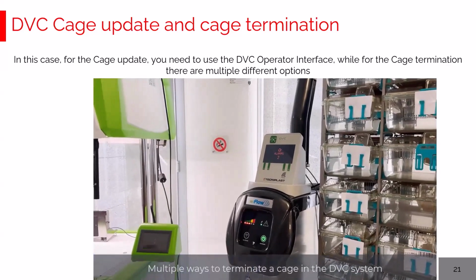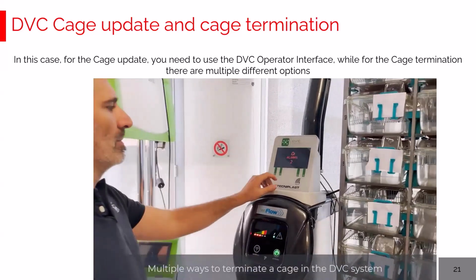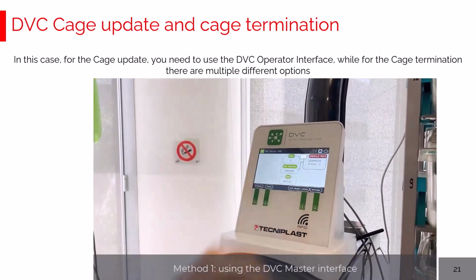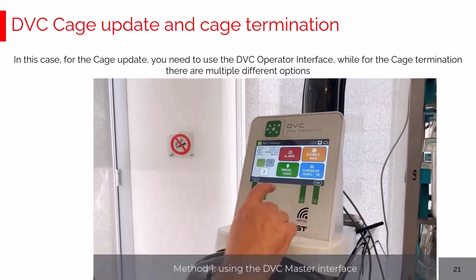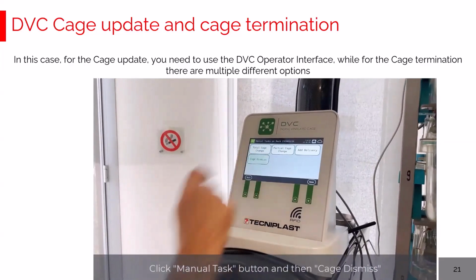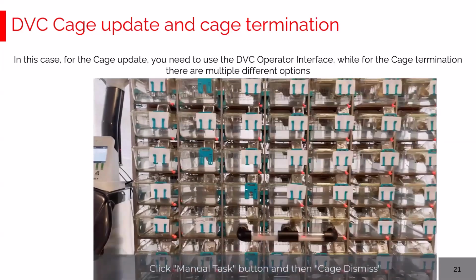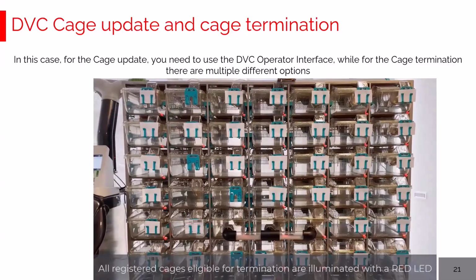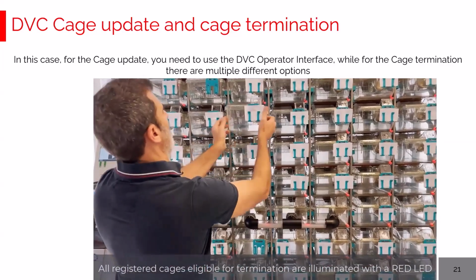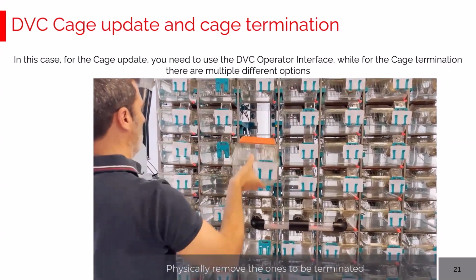Okay, so now let's talk about how to terminate one or multiple cages. There are multiple ways to do so. The first one we want to show you is through the DVC master interface. By going to the manual task, there is a button called the cage dismiss. By clicking this button, all the registered cages are illuminated in red. These are the ones that can be terminated simply by physically removing from the rack one or multiple cages.